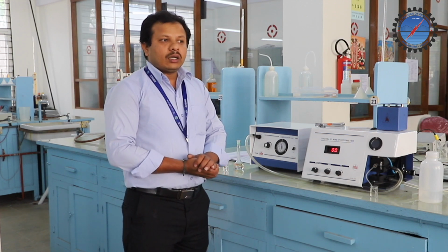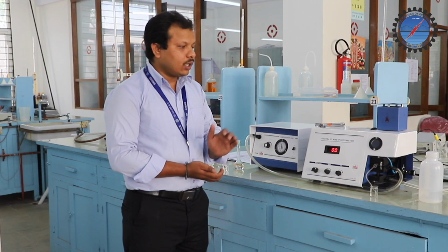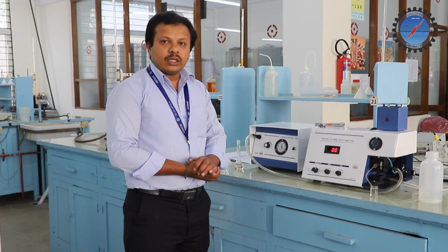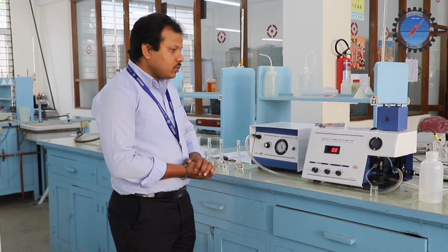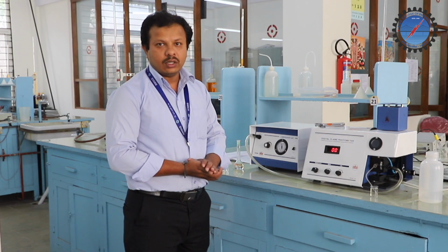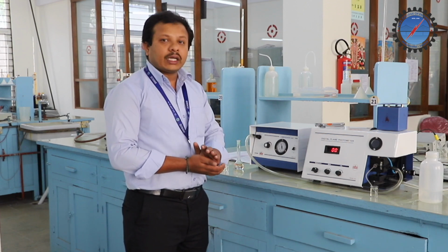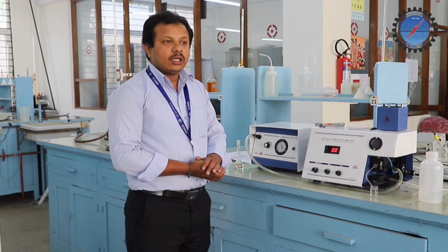When alkali or alkaline earth metals are exposed to high temperature, like here where we are using a flame, the atoms are excited to a higher energy state. There it is unstable, hence it comes back to its ground state. While coming back, it gives a characteristic wavelength. That characteristic wavelength falls in the visible region of the electromagnetic spectrum. Therefore, the characteristic wavelength gives the type of element present in the given water sample.